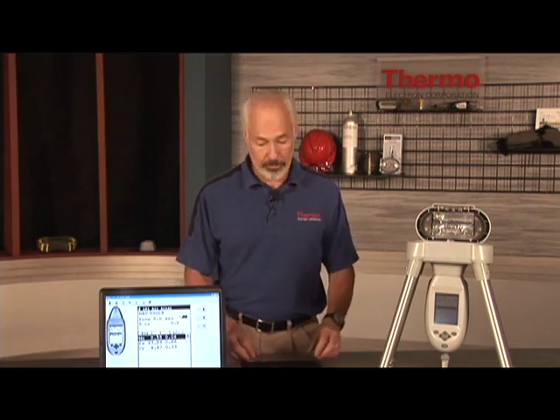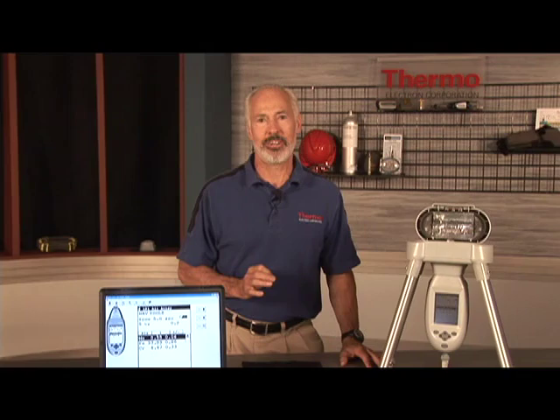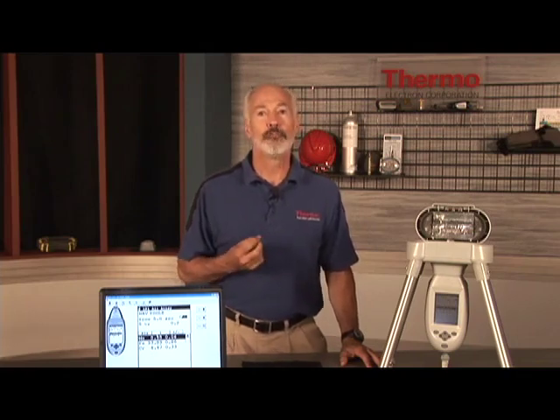An example of a more challenging analysis would be the testing of the nearly twin alloys of 304 and 321 stainless steels. These two alloys have overlapping specification ranges, with the exception of a fraction of a percent difference in the titanium content. Titanium is added to 321 as a stabilizer for withstanding certain corrosive chemical environments.